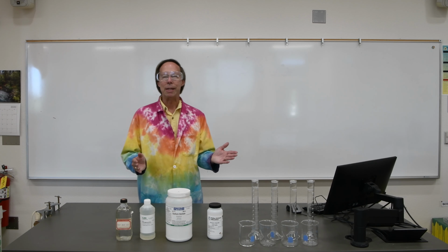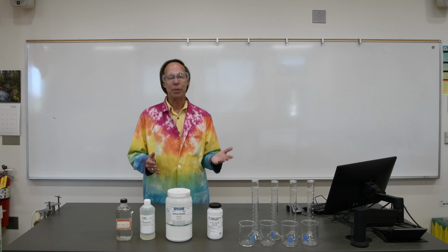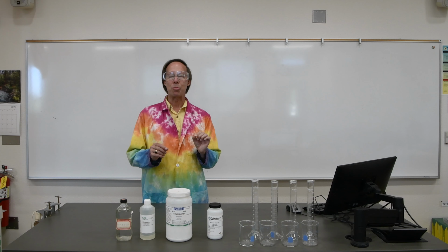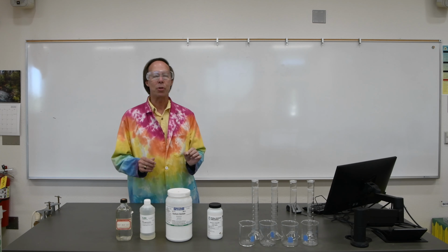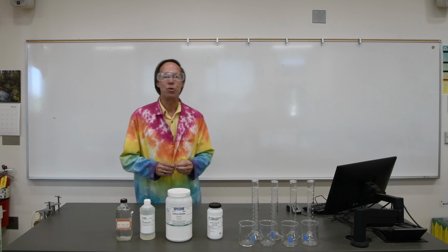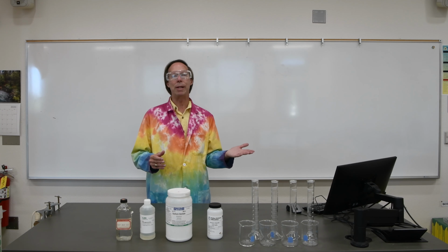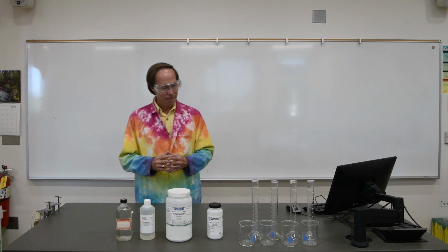You don't have to worry about getting it exact. It should be relatively close, but whatever the concentration is, you're going to measure it specifically anyway. So we're going to determine it based on the masses you record precisely. If it's 5.1% or 4.8%, that's okay as long as we know what it is.